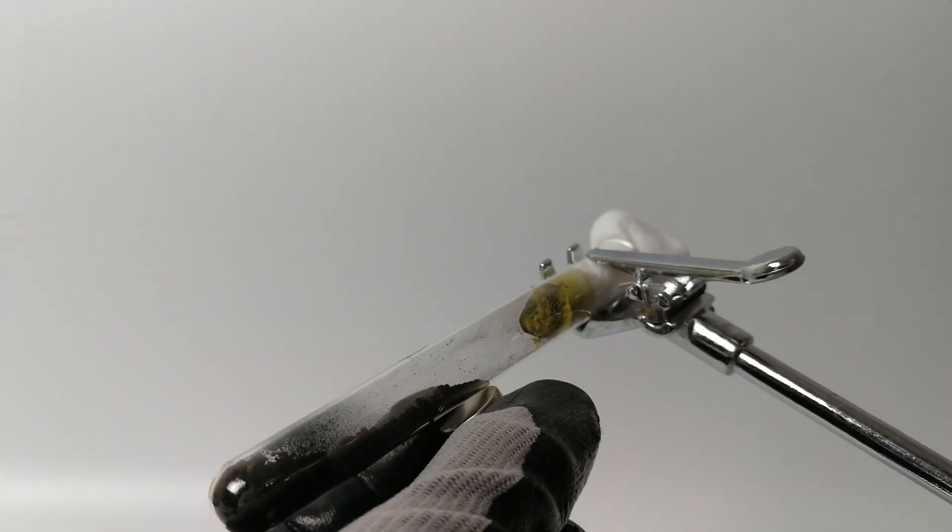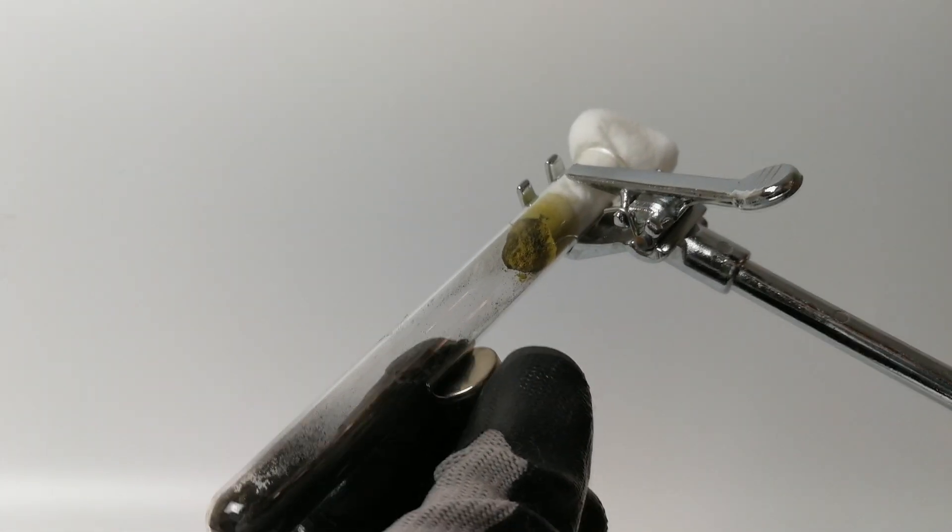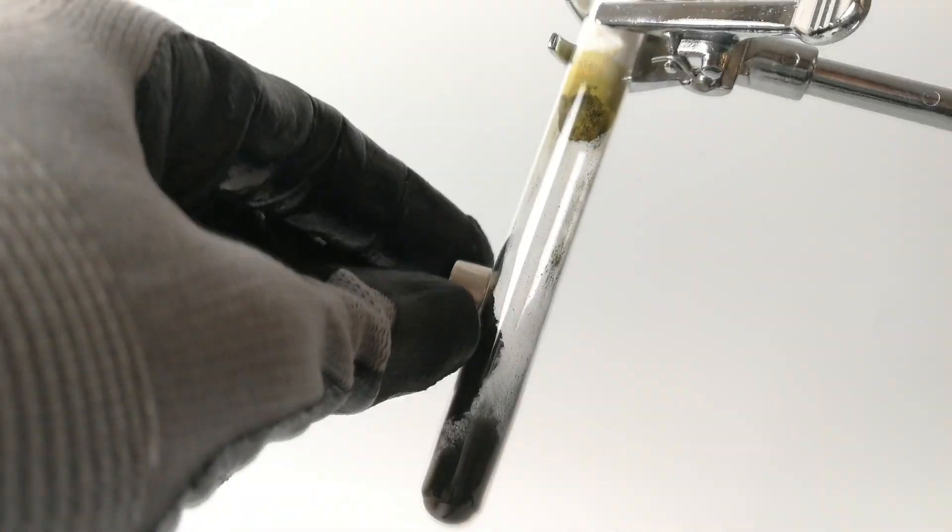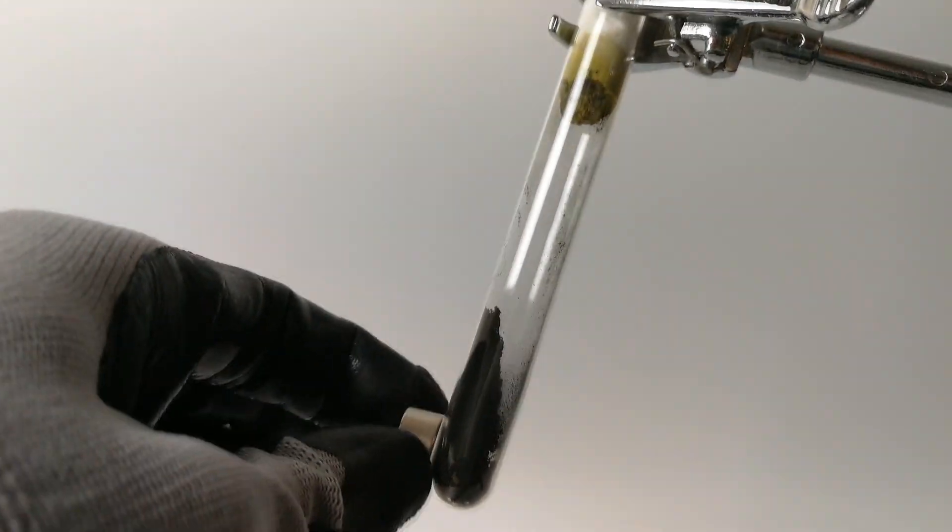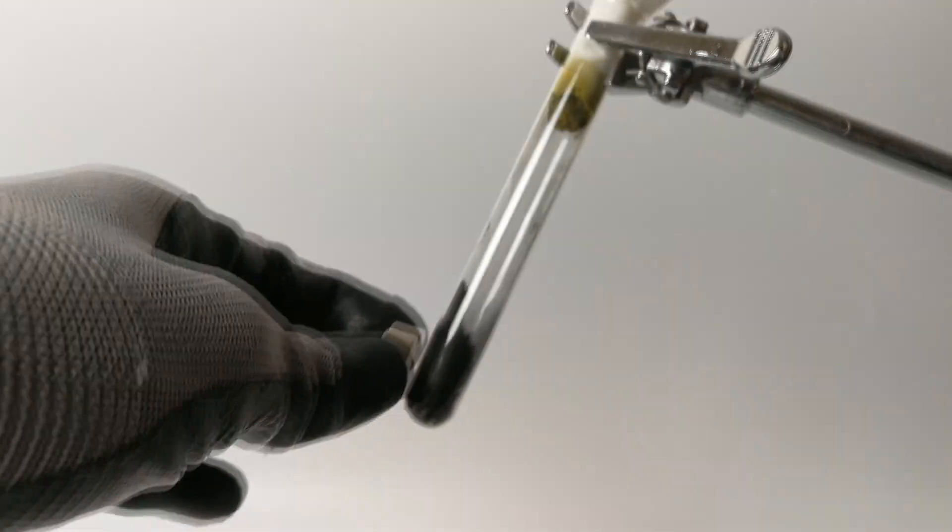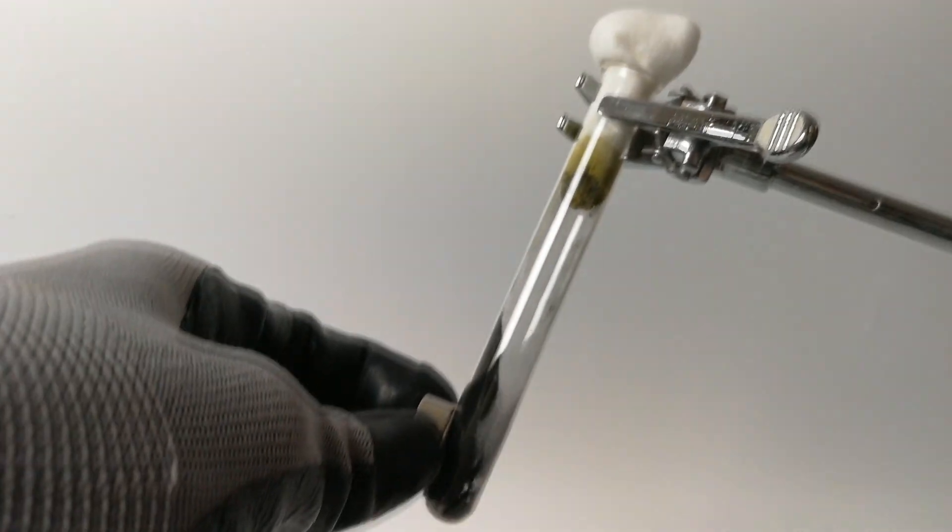The resulting mixture of iron and its oxides is definitely magnetic. The particles of iron metal that we've made are extremely fine and pyrophoric, meaning that they can ignite upon contact with air.